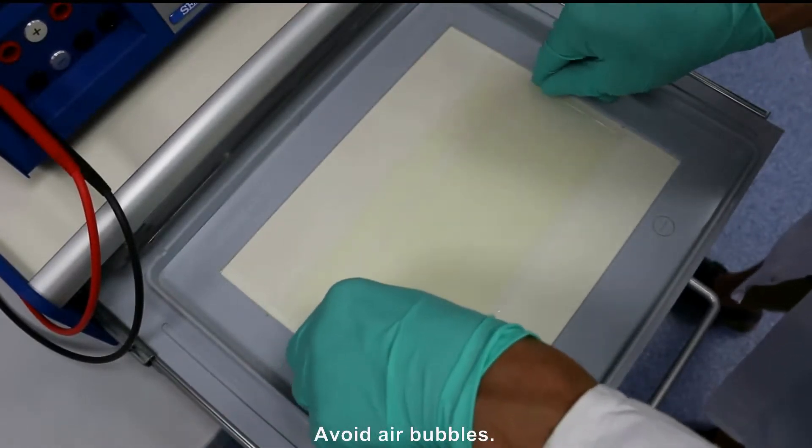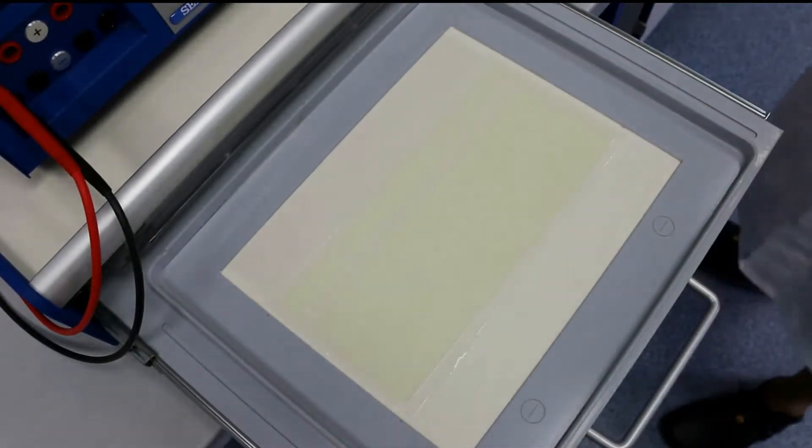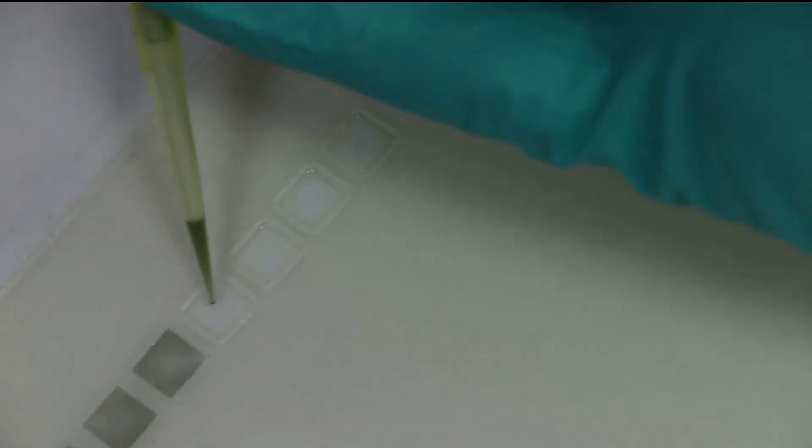Avoid air bubbles. Load samples into the pre-casted sample wells.